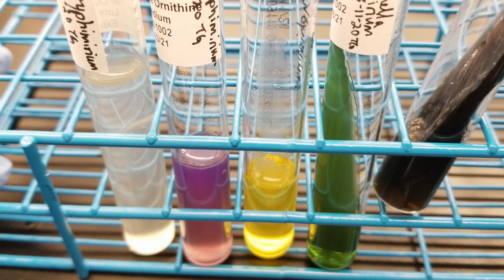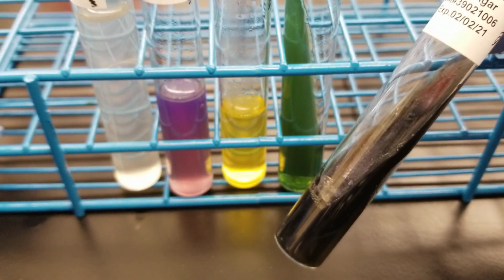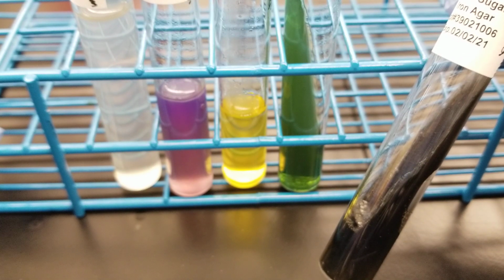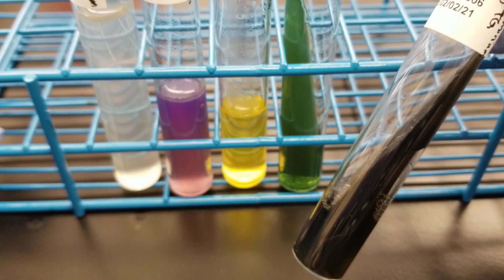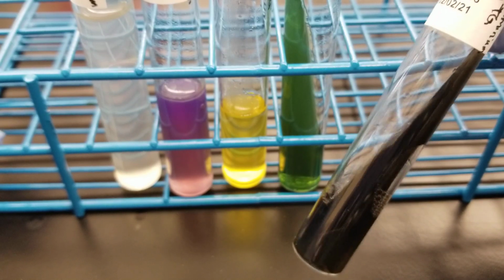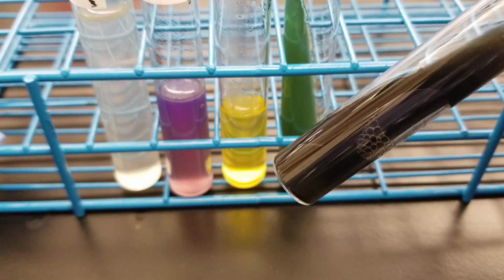So I'm not sure why the slant is actually black up here, because it should be alkaline over acid with H2S production. And in my notes, it says weak, and that's from our textbook. So this strain obviously has a little more to say about that.